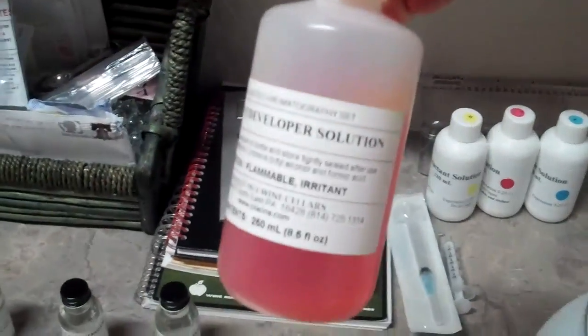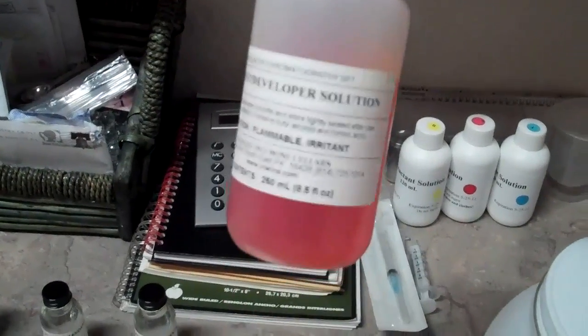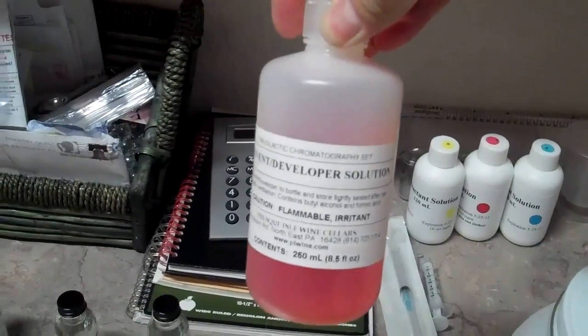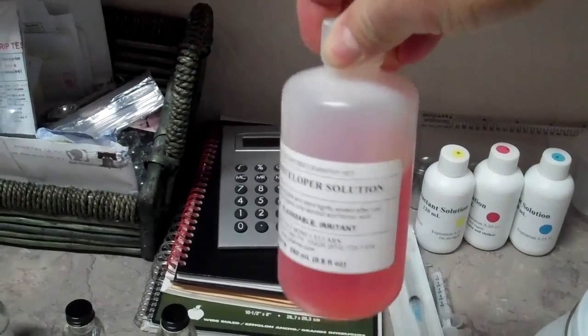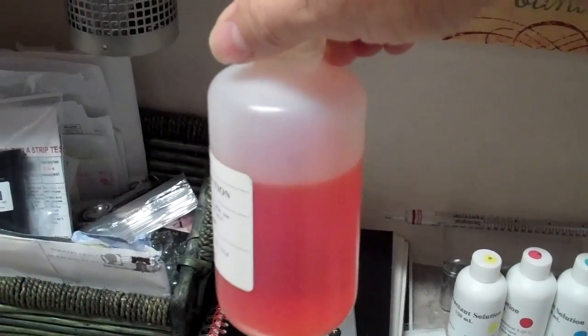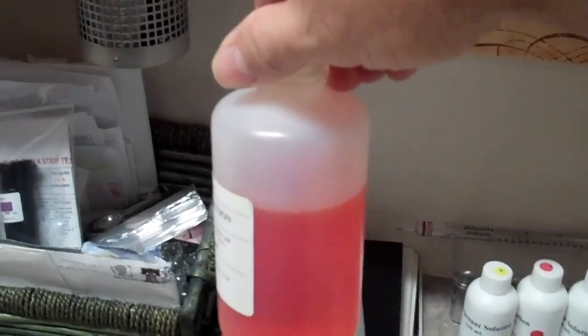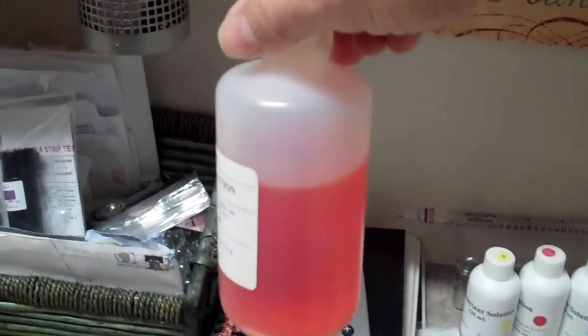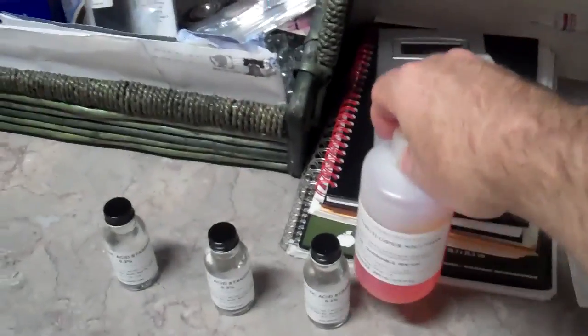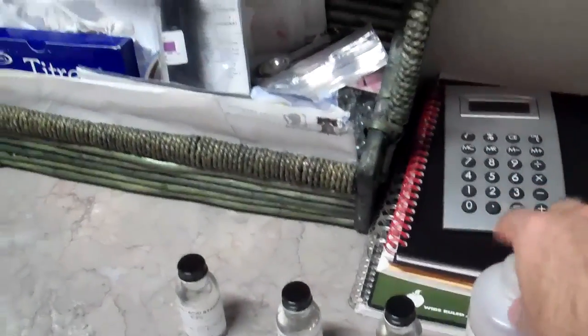This is the solvent that comes with the kit. This kit came with eight and a half ounces and I've run a total of about six tests so far and that's all the solvent that I've used. The solvent's reusable. What you don't use, you pour back into that container when you're done and seal it up and it's good to go.